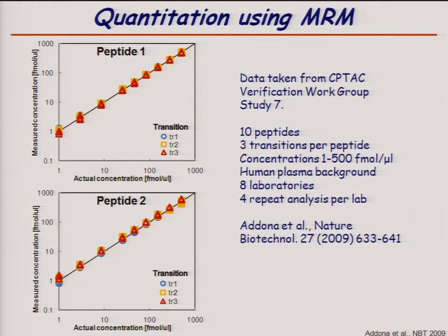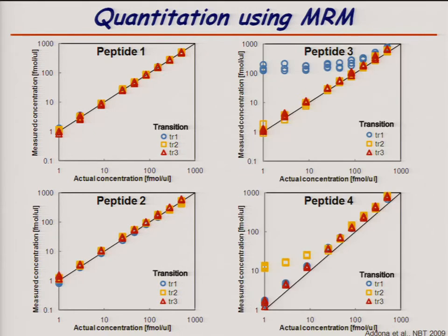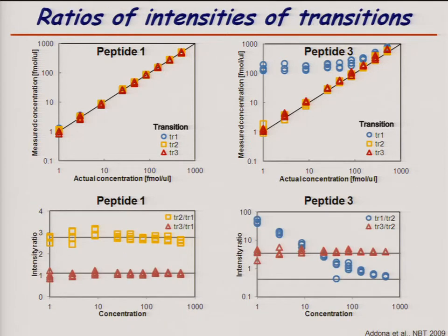But in a few cases, one would get interference. For example, in peptide 3, transition 1 does suffer from interference, and in peptide 4, transition 2 suffers from interference. So how do we think about this? We devised a simple model.